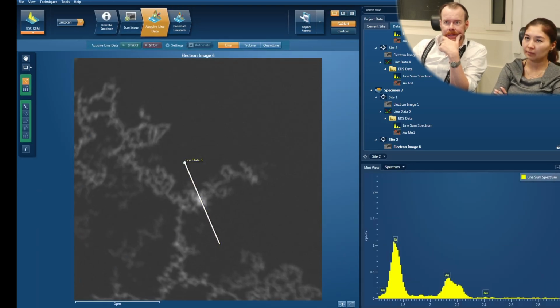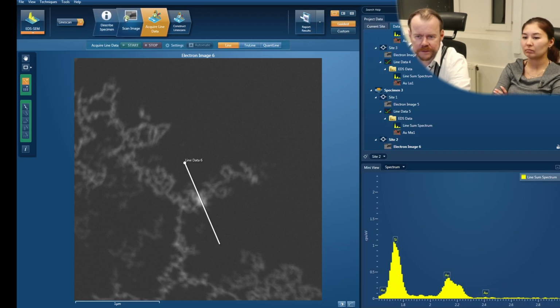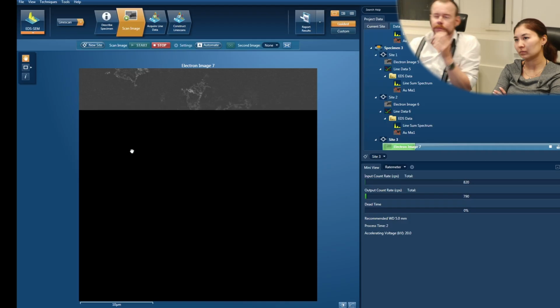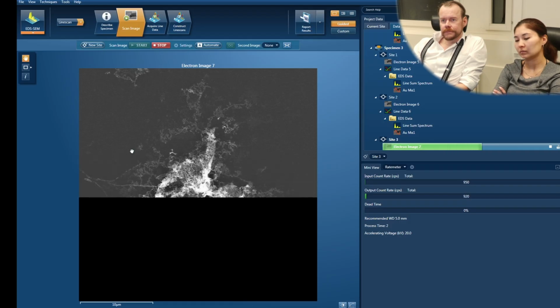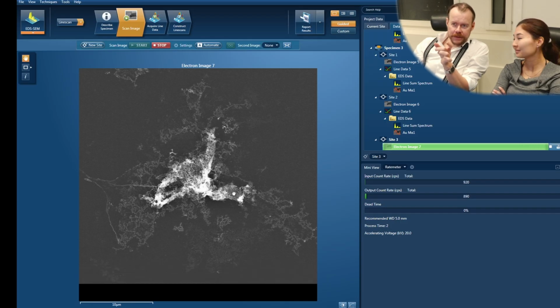Let's try an even bigger one. Here we have a large aggregate. So a lot of particles there, right? New site, start. So now it's 10 microns, the scale bar there. The whole object there is about 10 micron wide. And since this is silicon and gold is of course quite dense, at least a couple of microns we probably have. So let's scan straight across here.